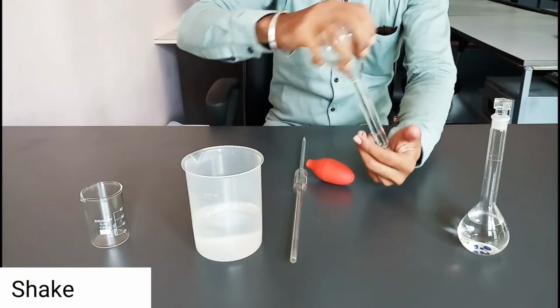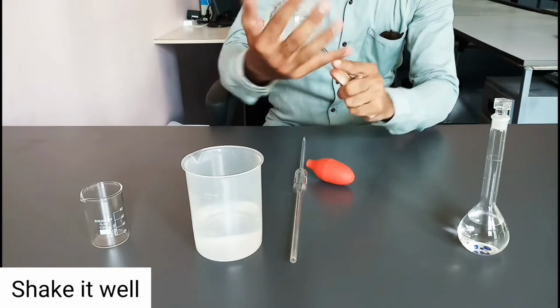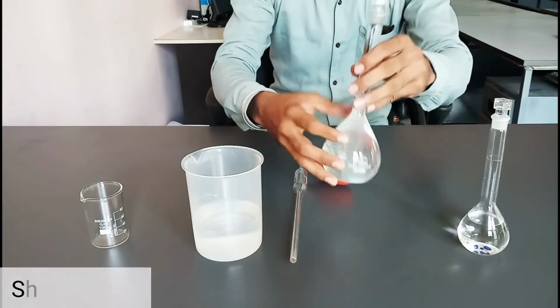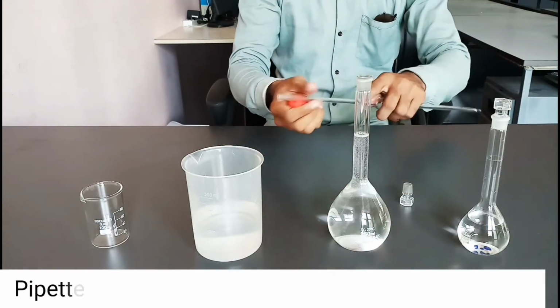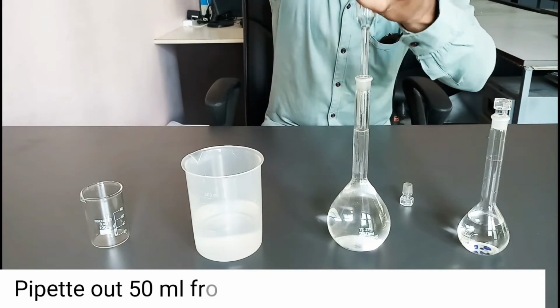Shake it well. Pipette out 50 ml from it and transfer it into a 100 ml beaker.